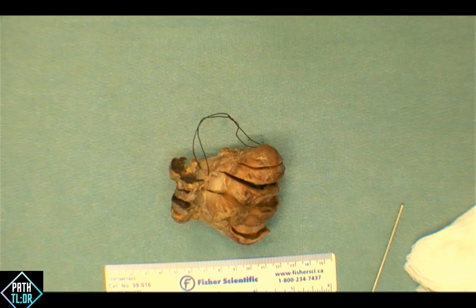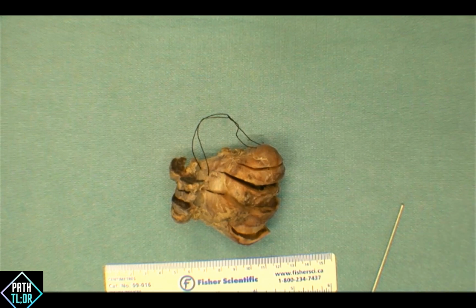But again, this one, especially for follicular lesions, you have to be a bit more deliberate in terms of sampling more of the capsule, because that's often the challenge with these cases. So I understand it's better to always oversample than not in these types of scenarios.